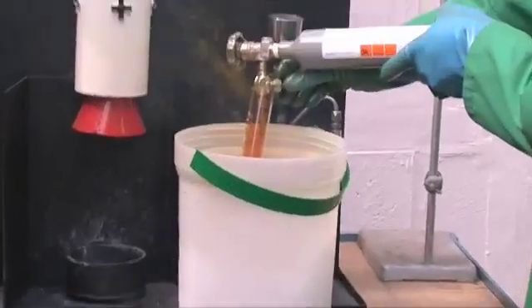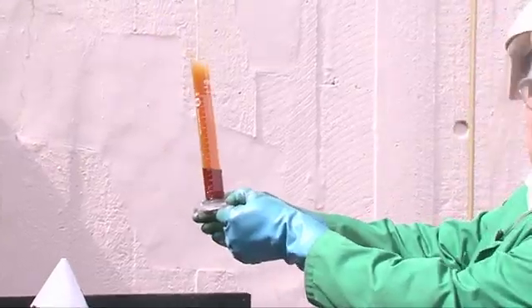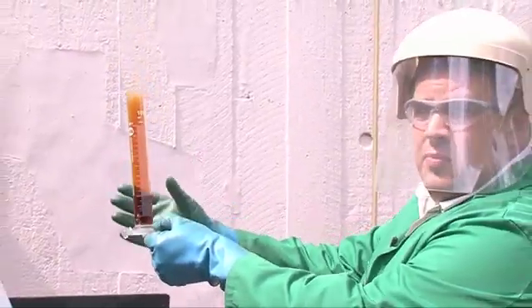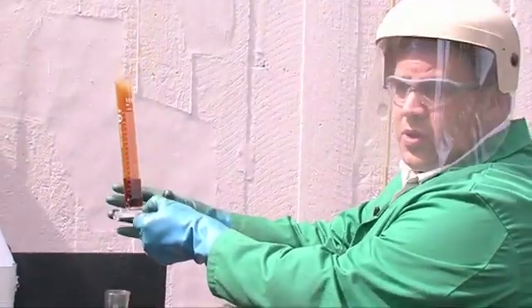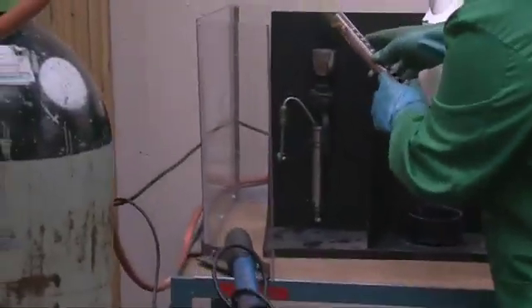You have this liquid with a dark brown gas above it. You can see the orange liquid with the vapor above. Now it's very volatile. It boils at 21 degrees C, so we have to keep it cold and we put it into the reaction chamber.